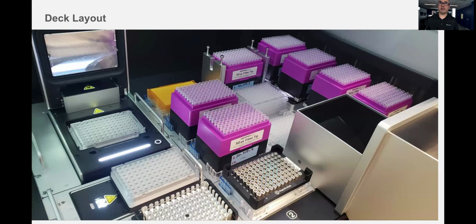And the panel, when doing the hyb capture, for me is one of the most precious reagents. I have that in a single well, and when I start setting up my hyb mixes to do the overnight capture, I use single tip pickup. That's why I need all the extra space to do a single tip pickup. It uses just the corner channel of the 96 block. That's why I need the additional space to the left and to the bottom so that the overhang doesn't collide with any of the labware.